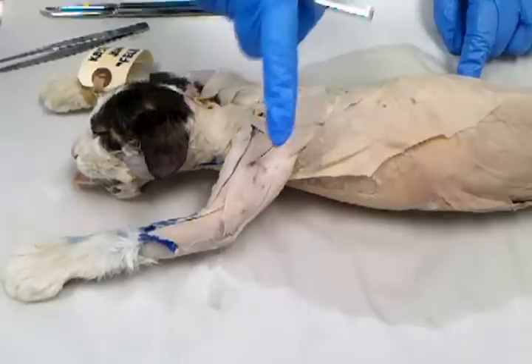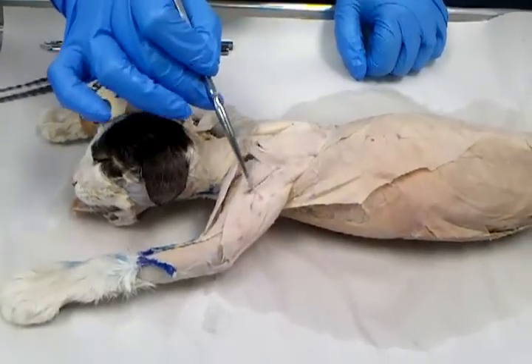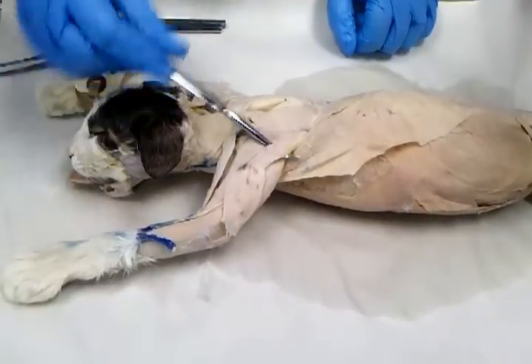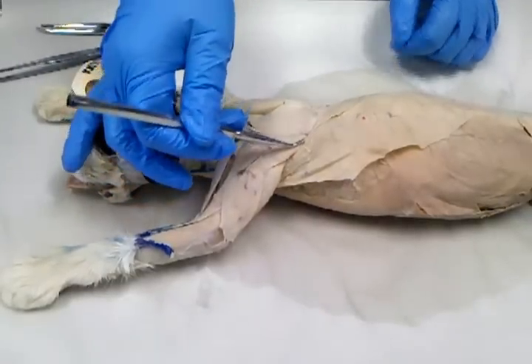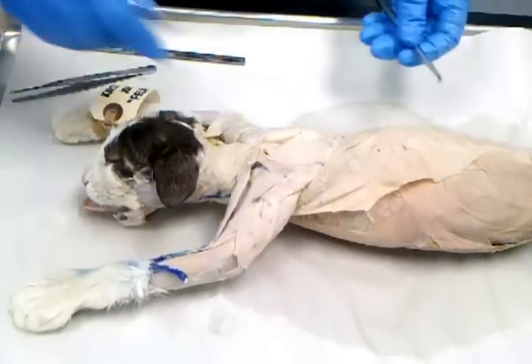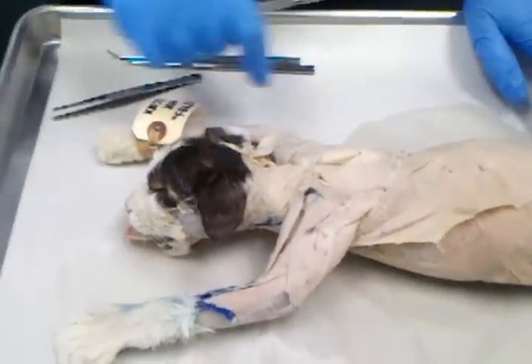It goes in the same order for the deltoids. So clavodeltoid is the top muscle. Acromiodeltoid is the triangular shaped one right here. And then spinodeltoid is the lowest. If you follow where the spinodeltoid is going, where it comes to a point is at the same place where the spinotrapezius comes to a point. So if you need a positional way to find the muscles, if you don't know what's pinned.